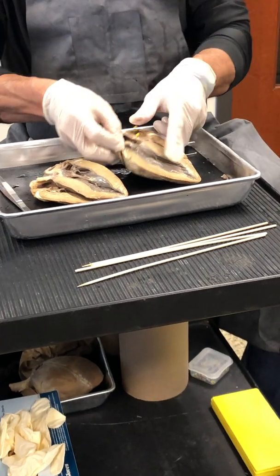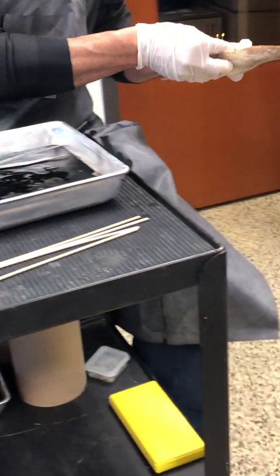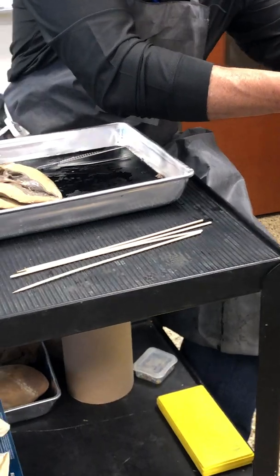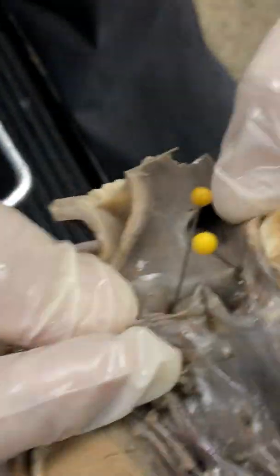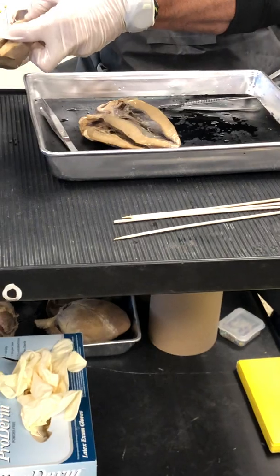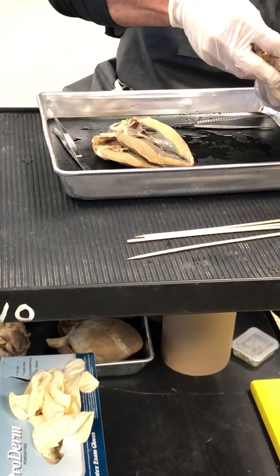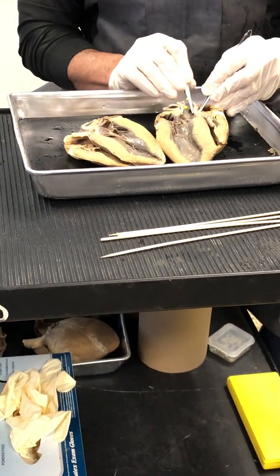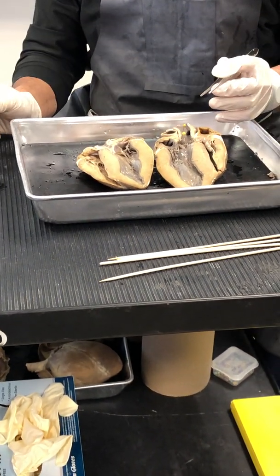So please look, folks. One, I want you to find the coronary artery. And number two, the size of the lumen of the coronary artery compared to the lumen of the aorta, which is right there. Can we do a comparison between the two lumens? Yellow pin is the coronary artery. That is the size of the coronary artery lumen, and this is the aorta right here. That's the aorta lumen. No comparison.